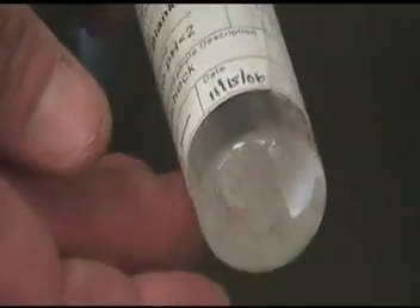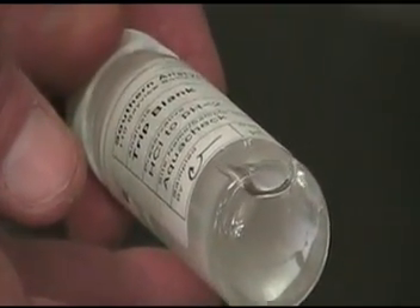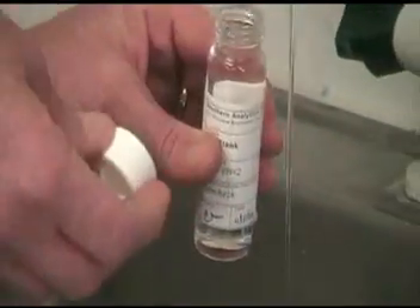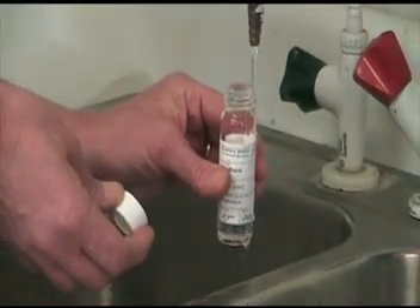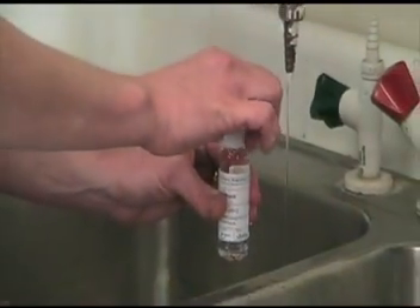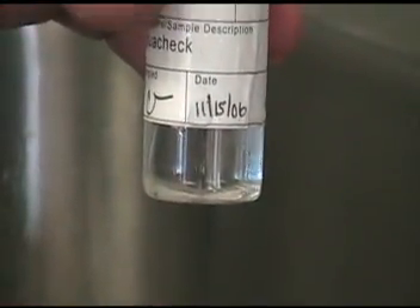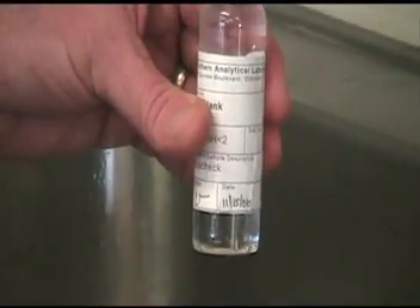In this illustration, the sampler still has some air in the vial, which may cause the sample to be rejected. Simply take the cover off and carefully add some more sample, so that it just overfills the top of the vial. This is called a reverse meniscus. Re-close cap and check for air bubbles as before. Use this same procedure for all small SOC and VOC vials. Transport to lab at 0 to 6 degrees Celsius.